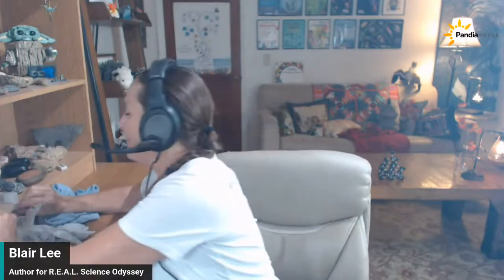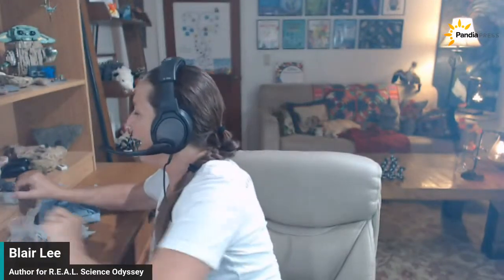You'll also want specimens. I have a leaf, a feather, and corn — which is going to have lots of starch in it. I also have a couple of other slides that I'll show you how to make, but I made them yesterday just to make it easier.